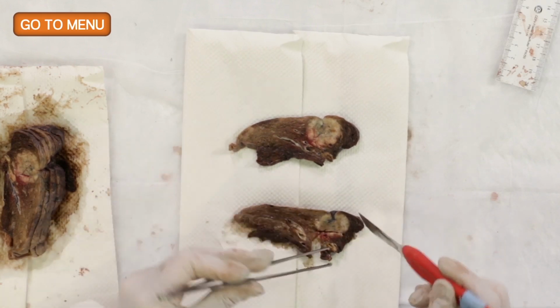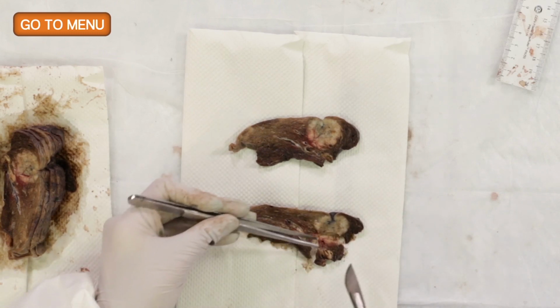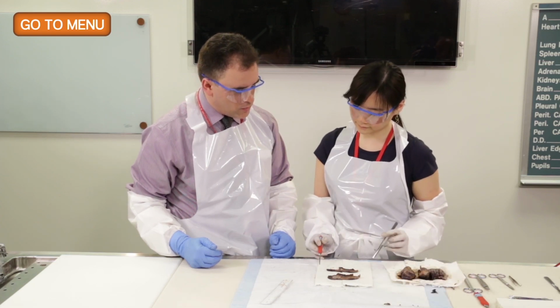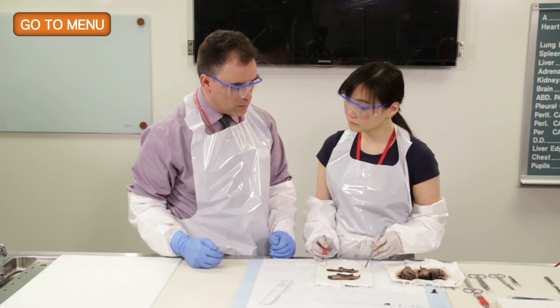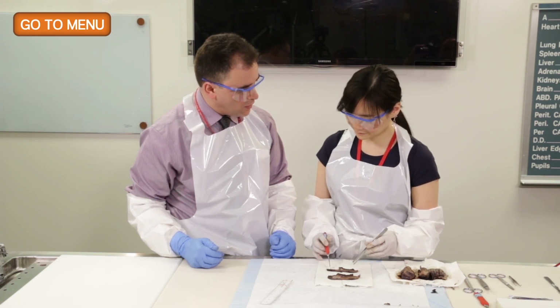The other consideration is that the thickness of the slices should not be too great. Certainly if you're having difficulty closing a cassette, the tissue is definitely too thick. Probably 2 to 3 millimeter thickness is about right. You can go a little bit thicker with certain tissues, but beyond that it becomes again difficult to fix. So we've already sliced it thinly, so you can go ahead and continue.